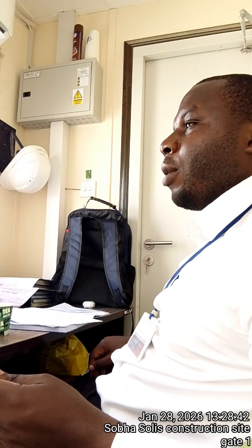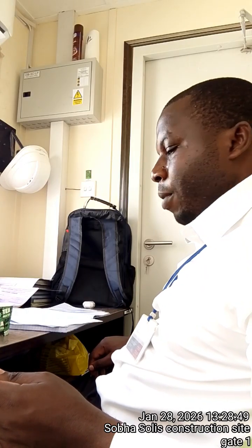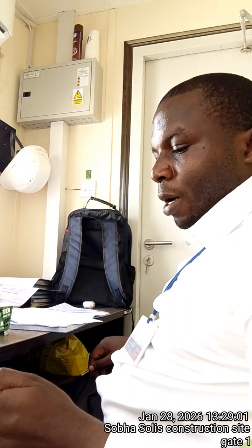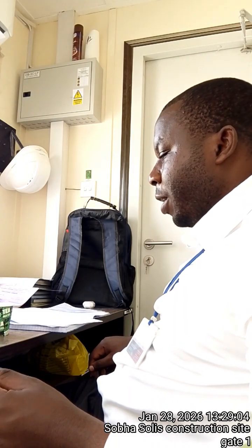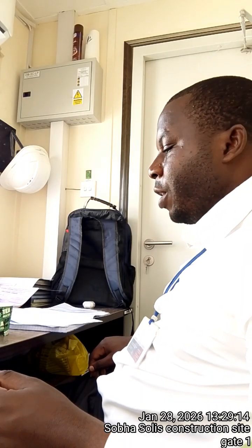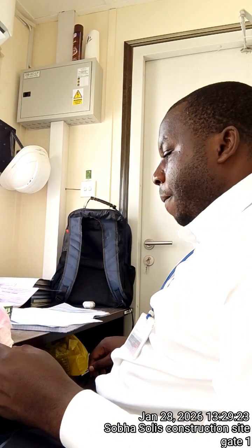This is because of the treatment, the hardness was broken down, reducing the alkalinity, hence nearly balancing the pH. So meaning that when more acid is added to the water, it causes this litmus, not litmus, but the indicator, it causes the pigment in the beetroot to change the color. And there was no effect upon addition at different intervals; I observed that colors changed to pink.